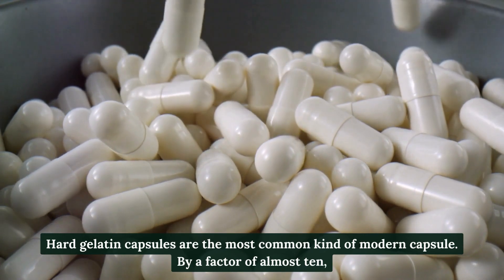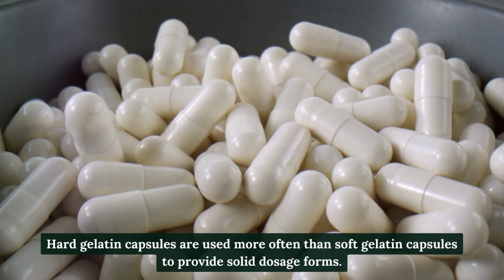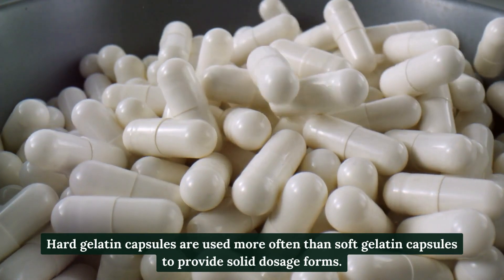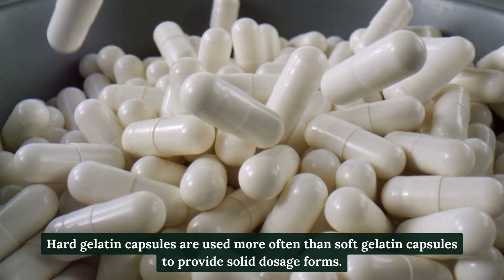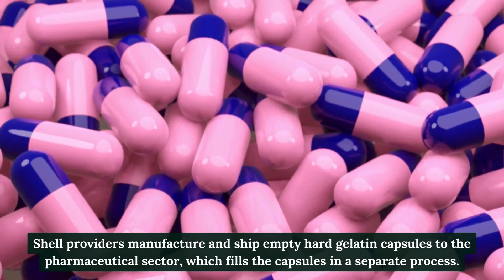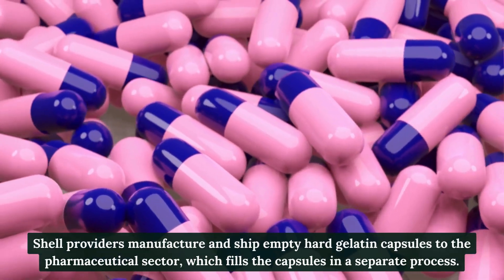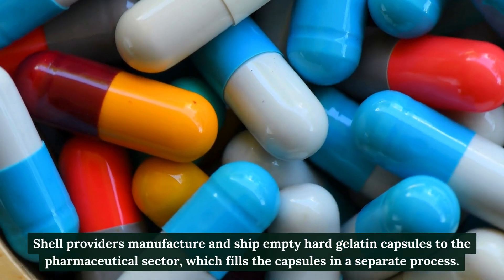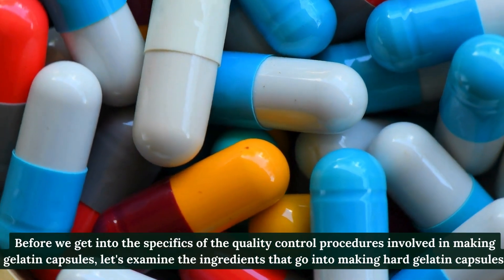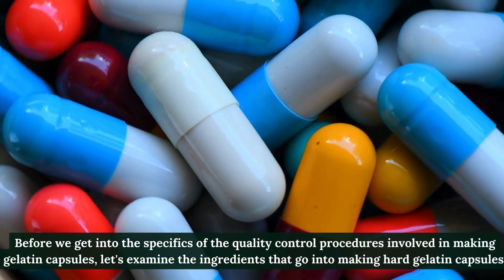Hard gelatin capsules are the most common kind of modern capsule by a factor of almost 10 — used far more often than soft gelatin capsules to provide solid dosage forms. Shell providers manufacture and ship empty hard gelatin capsules to the pharmaceutical sector, which fills the capsules in a separate process.